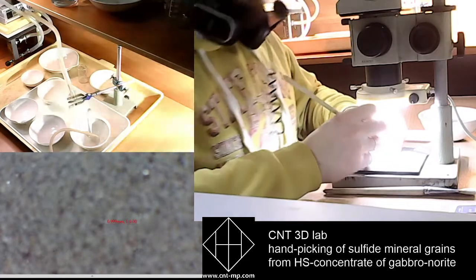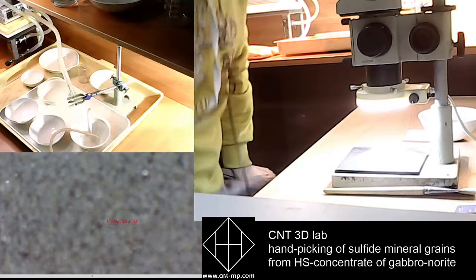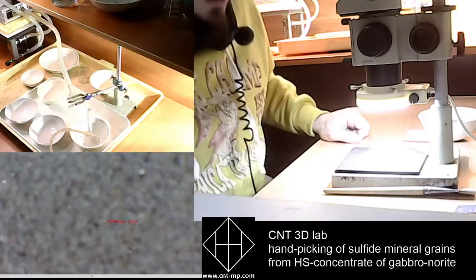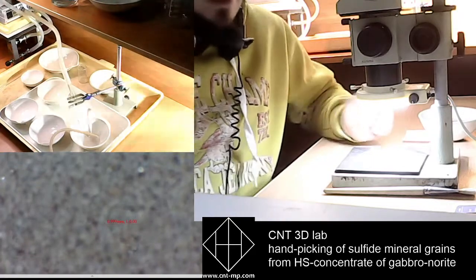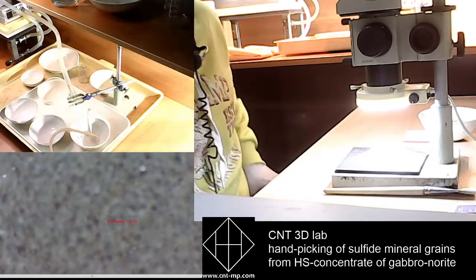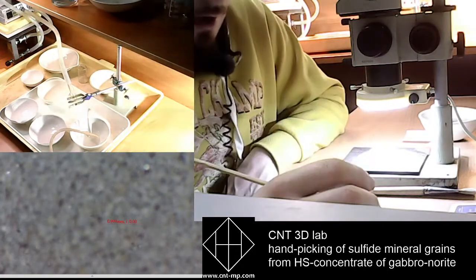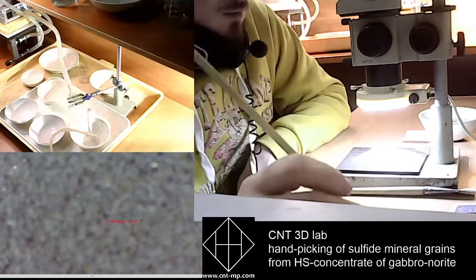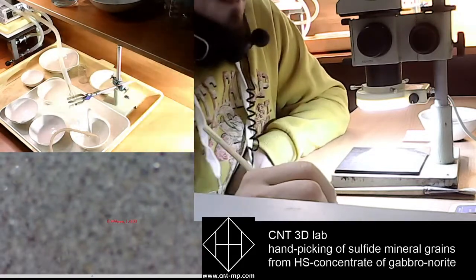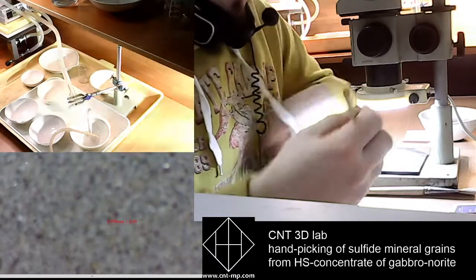But also, after we are done with sample preparation, we need to ask the client what kind of mineral analysis is needed for further mineral research, as there are many methods at grain size level that can be used for mineral identification. Depending on the method of choice, we will be able to produce sufficient samples.